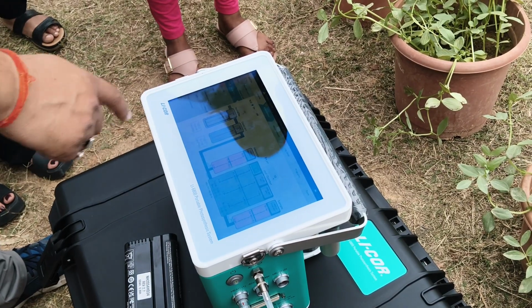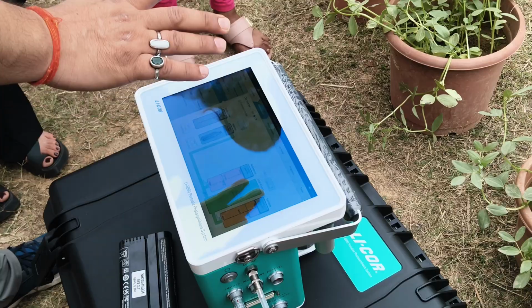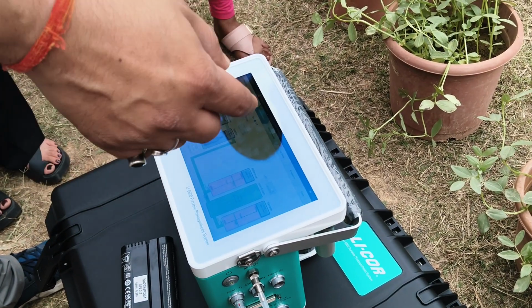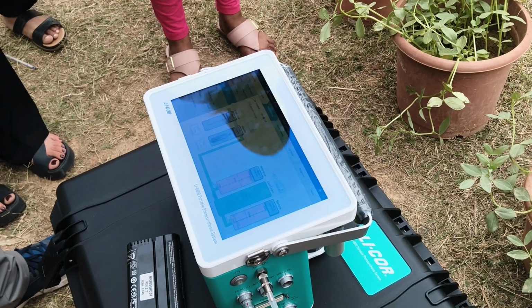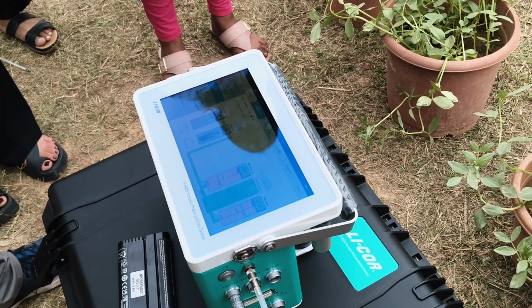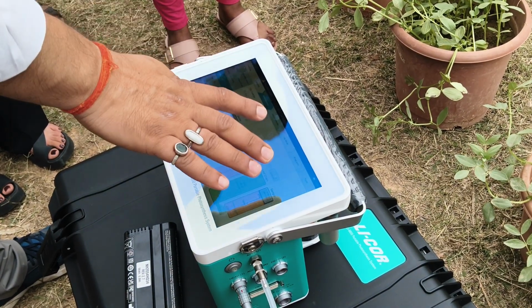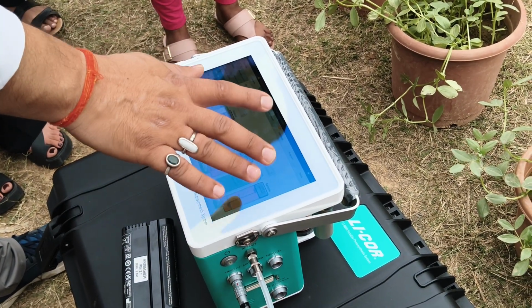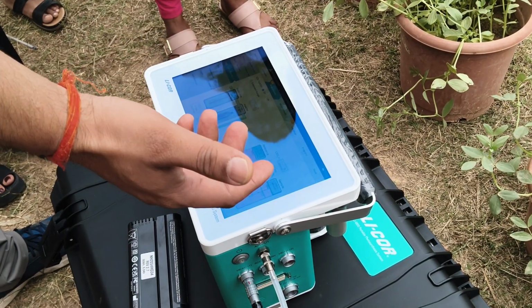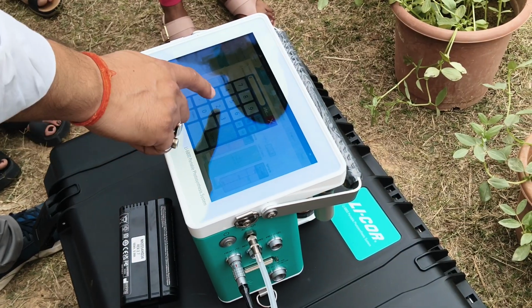Then we have already punctured the CO2 injector. If you don't want to use CO2 cartridges, you can also do the measurement by controlling. There is one long pipe you can put into any small closed box, so that the environment inside, the CO2, should be fixed. So if you don't want to use CO2 cartridge, then you can also use this equipment. Okay, now you can switch on the CO2. Normally in the environment it is around 400, so you can fix this CO2 at 400.